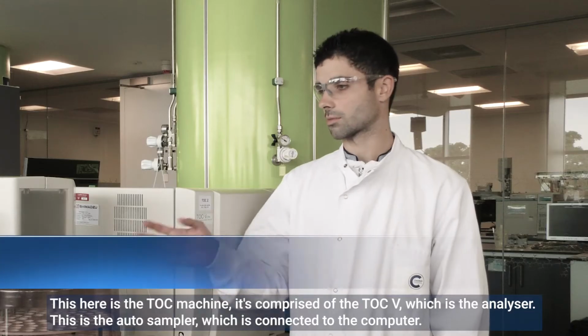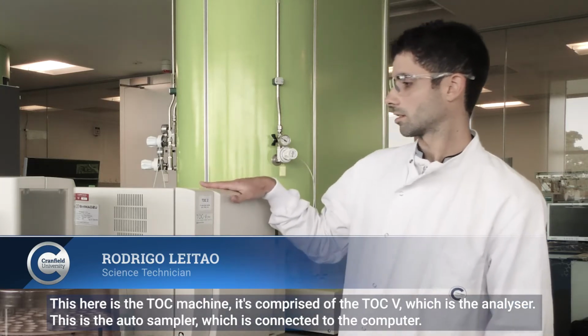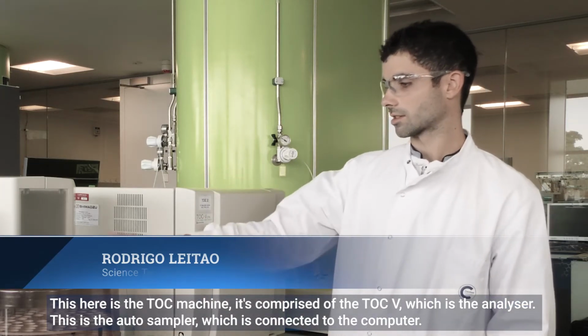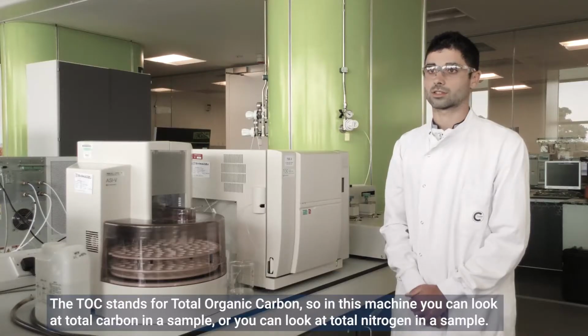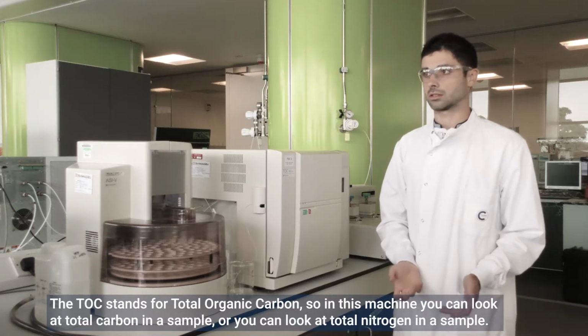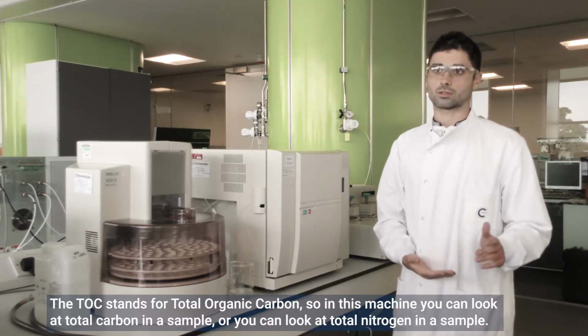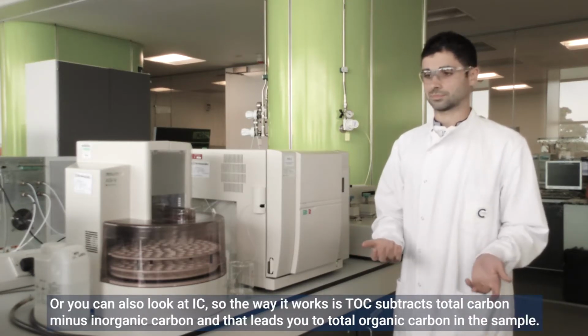This here is the TOC machine, so it's comprised of the TOCV, which is the analyzer. This is the auto sampler, which is connected to the computer. The TOC stands for total organic carbon. In this machine you can look at total carbon in a sample, or total nitrogen in a sample, or you can also look at IC.